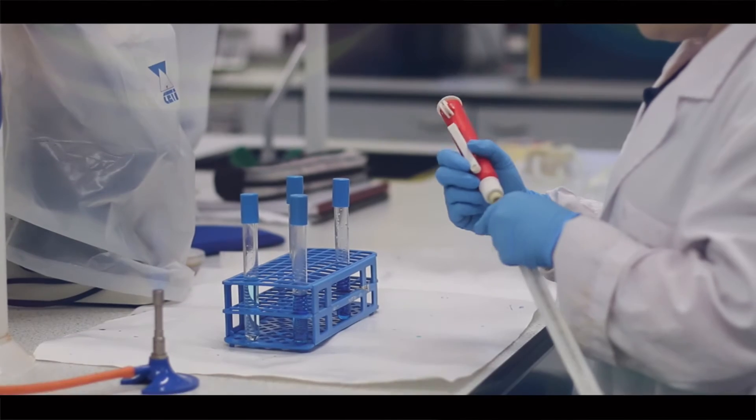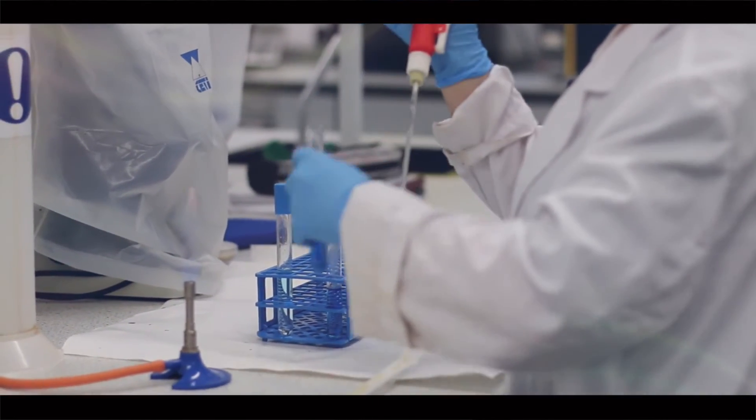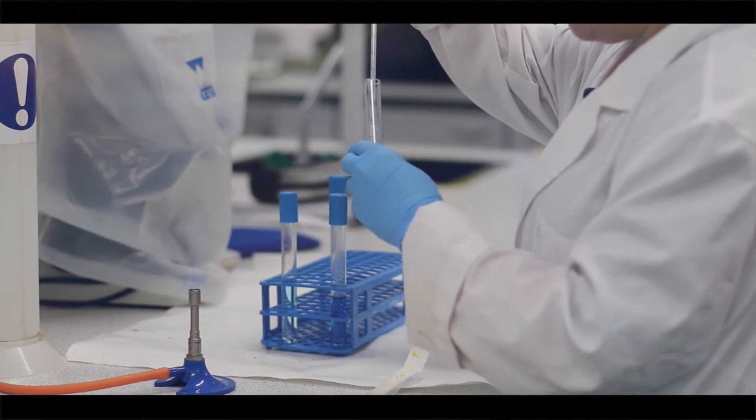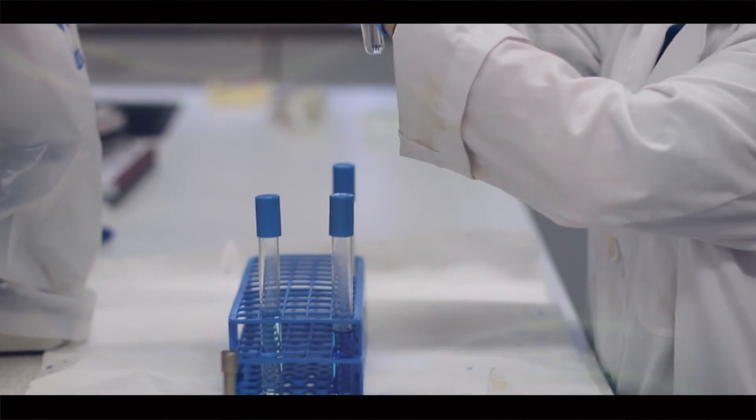Aseptic transfer of liquid from one test tube to another requires a lot of practice. We have to avoid spilling any material. The pipette itself at no point can come in contact with any surfaces, skin, or pieces of clothing.